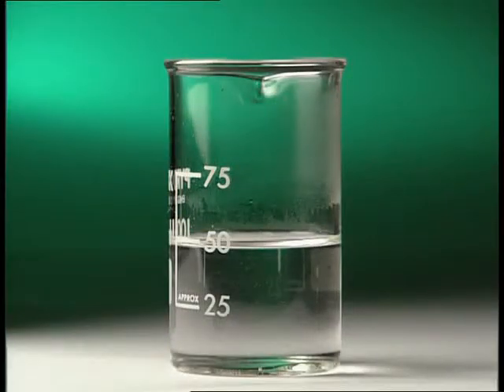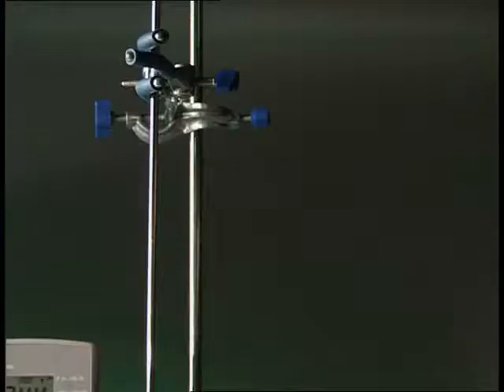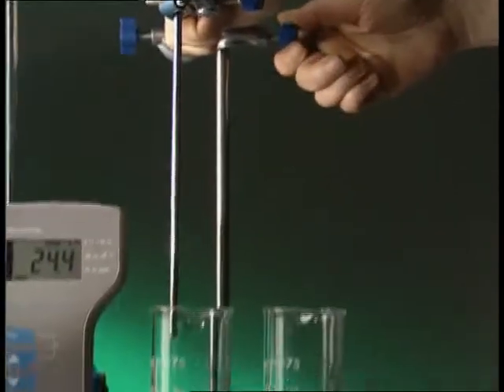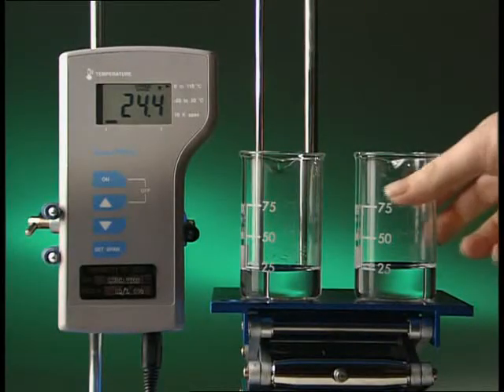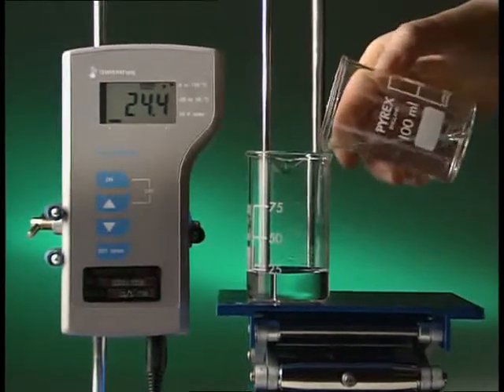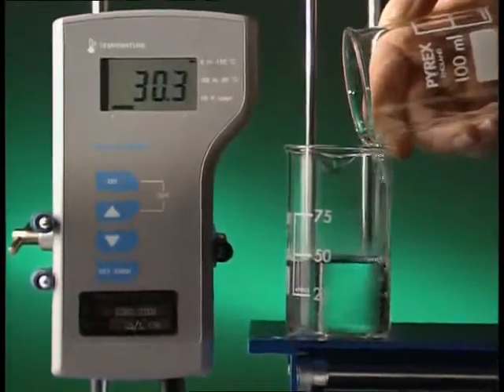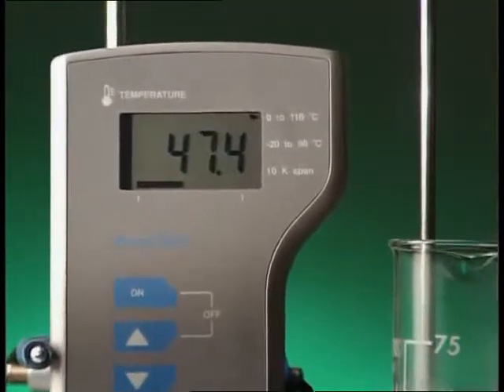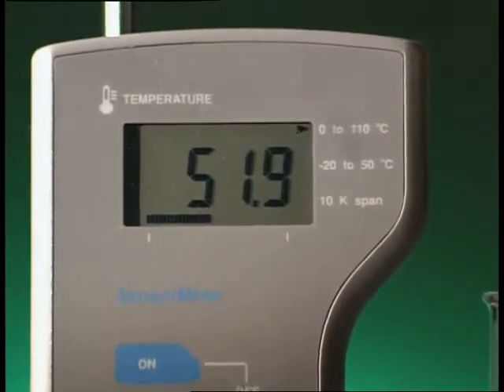Heat energy is being given out by the reaction, causing the temperature of the chemicals and the beaker to rise. An electronic probe measures the temperature change. The reactants start off at 24.4 degrees Celsius. Add them together and the temperature of the reaction mixture quickly rises. Heat energy is being given out, so it's called an exothermic reaction.